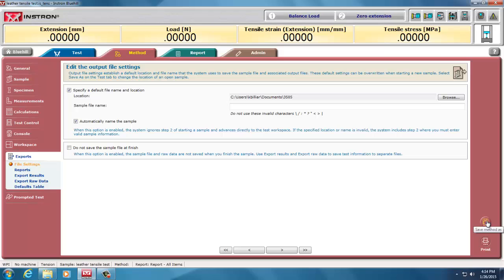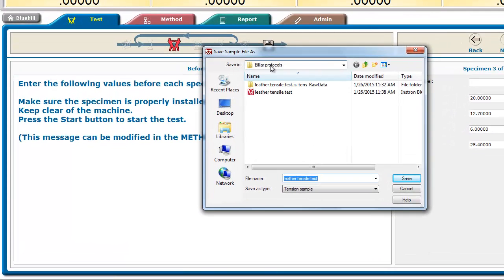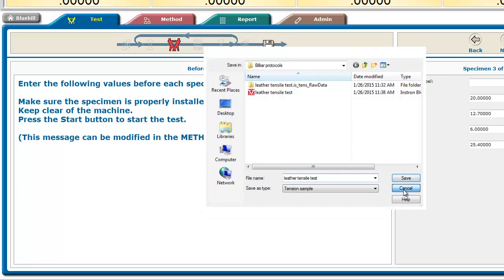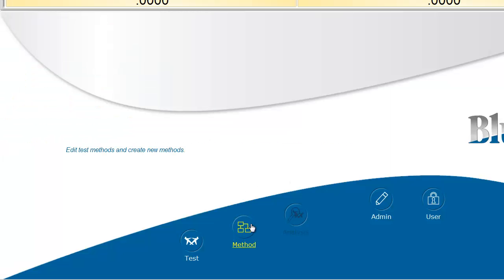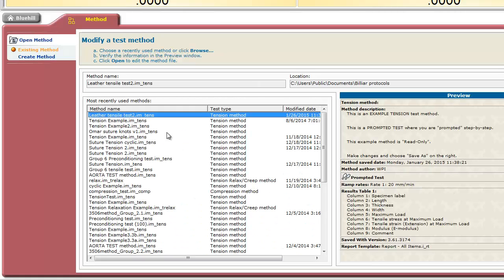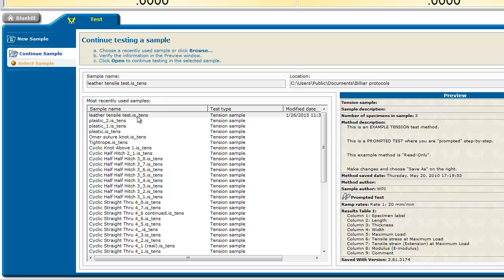So if I had done Save As during this test, and I had said put this in Billiar protocols, that might be where my data is. I had done it to save the protocol there, but it actually saved the data there as well because I was changing my protocol while running a test, as opposed to changing my protocol when just going under methods. So if I had gone under method and done Save As, then it would save only the protocol there, not the data.